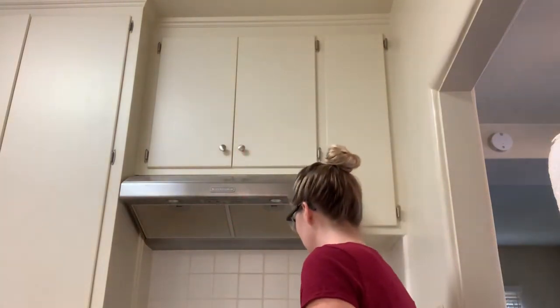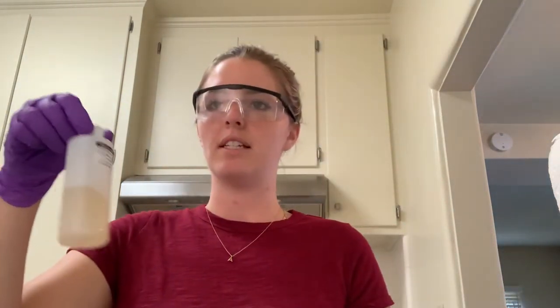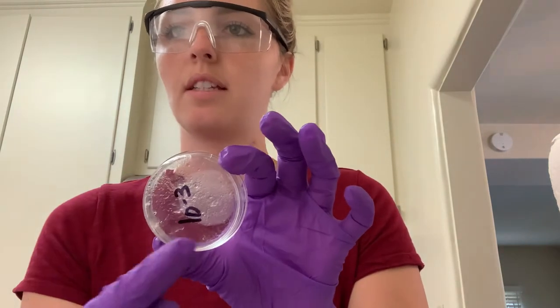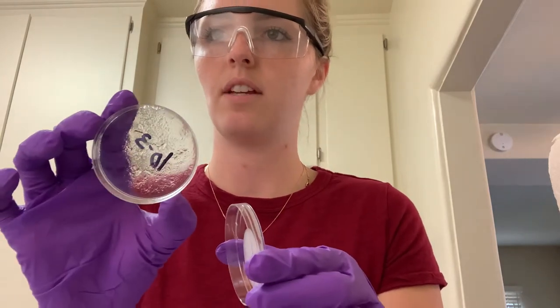I've been using hot water and boiling it to melt the agar down. Once it's melted, I mix it really well to make sure it's all incorporated, and then you pour it into each petri dish about halfway. That takes about 30 to 60 minutes to fully set up. You can see the agar is in the petri dish — set that aside and let it set up.